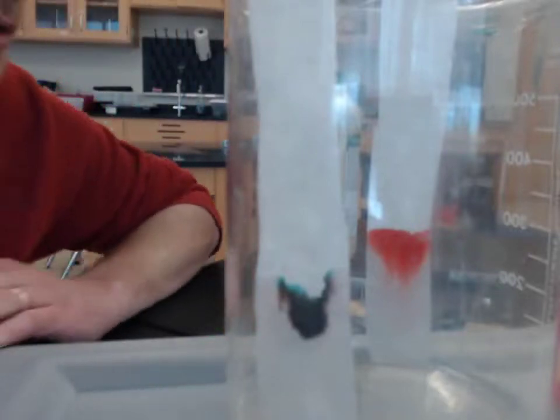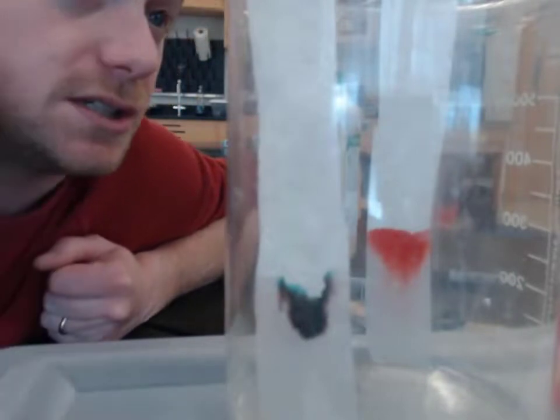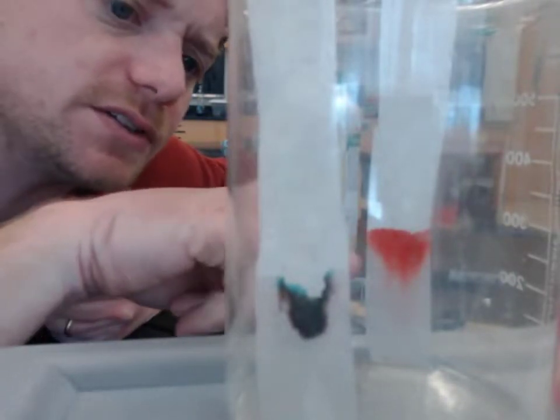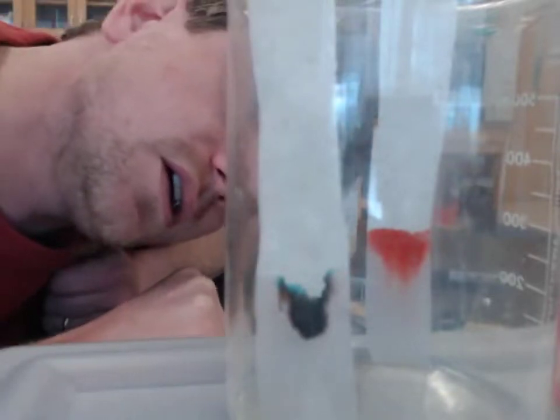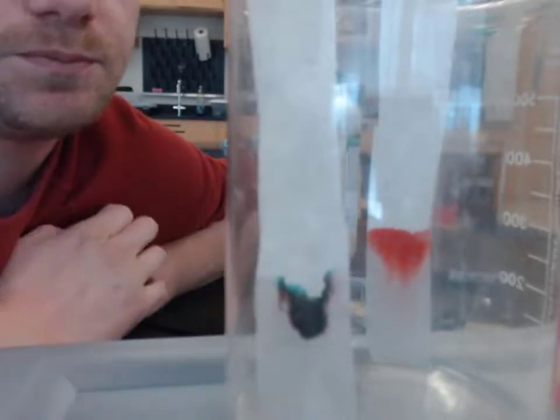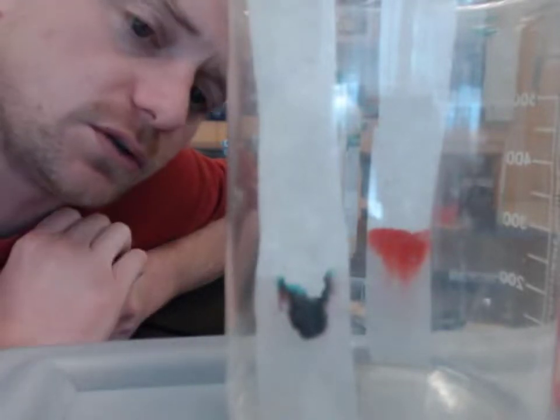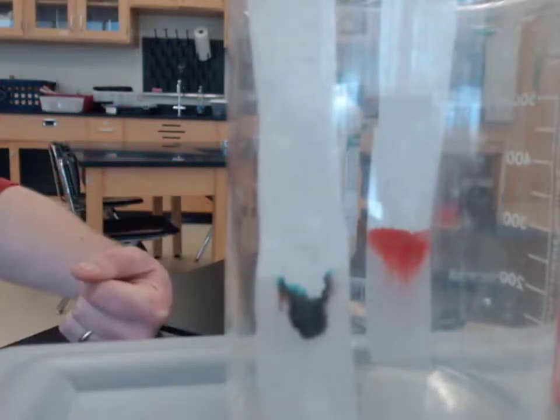And it looks like it's kind of being loosened up and pulled apart very easily, because its shape has changed more dramatically. You might say there's some orange or pink. It looks more pinkish, not in the camera. Just looking right here, it looks more pinkish at the bottom of the red, and eventually goes clear. But it might look a little orange to you, according to our observations that you see from the camera view.